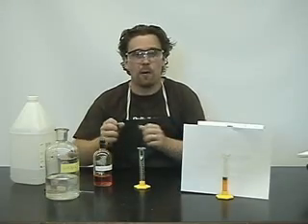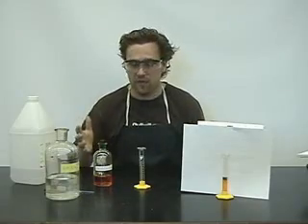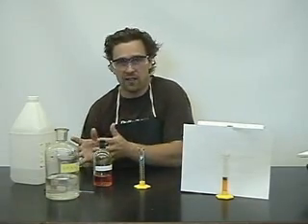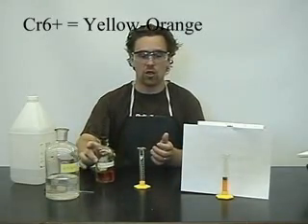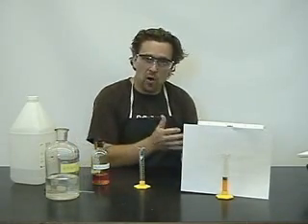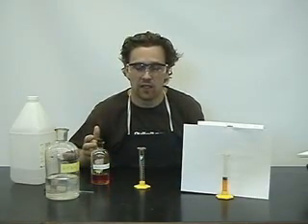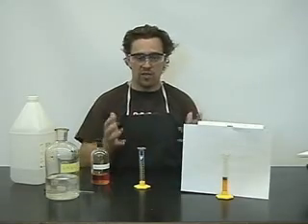So it goes from a positive six to a positive three. Well the really awesome thing about it is when it's in the form of the positive six, it shows a yellowish orange color. When it's a positive three, it shows a dark green color.